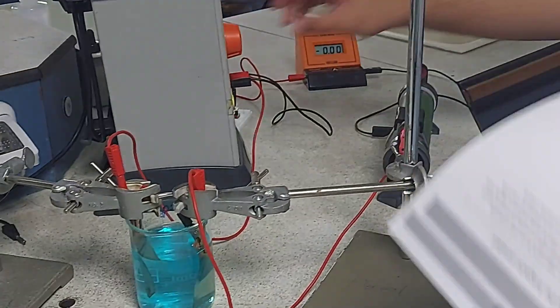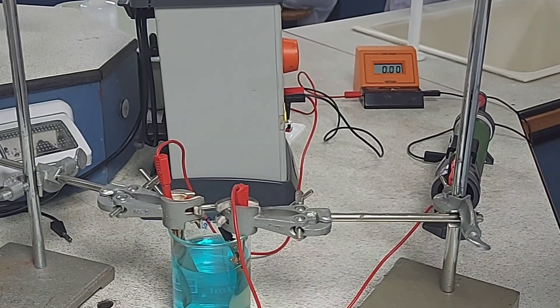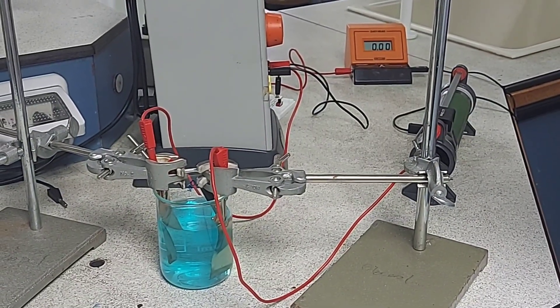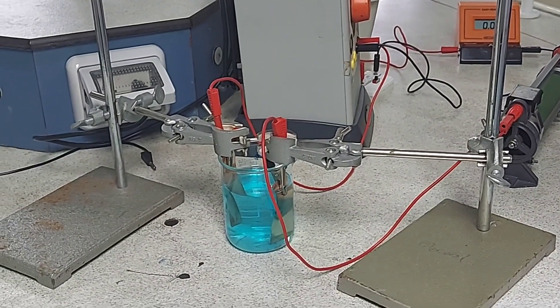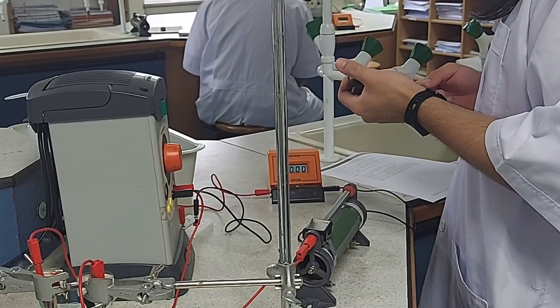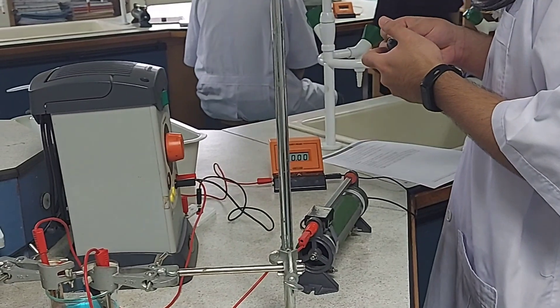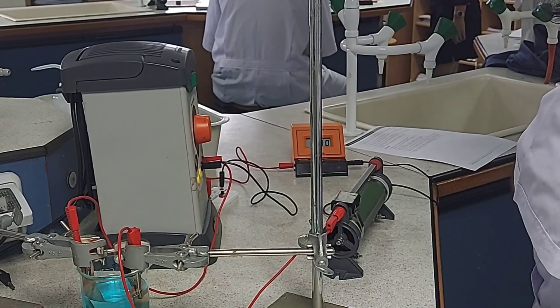You can watch the whole experiment as it is being carried out. Once you finish the required 40 minutes, take the anode, wash it first with distilled water and then with ethanol, measure the mass of the anode at the end of the experiment, and then do the calculations.